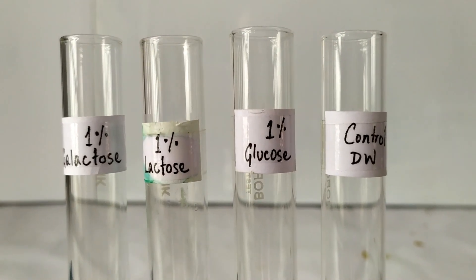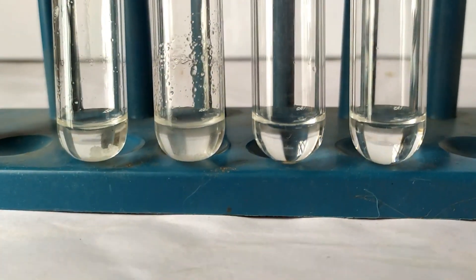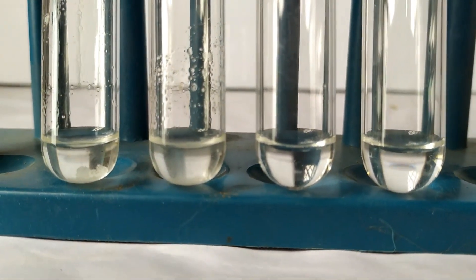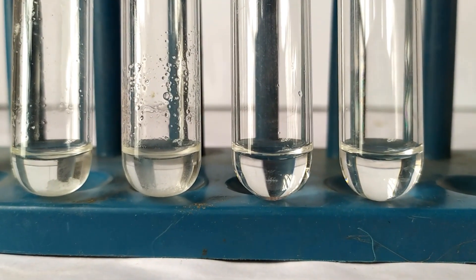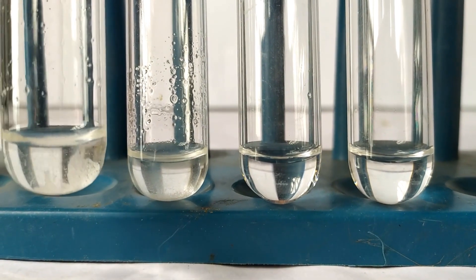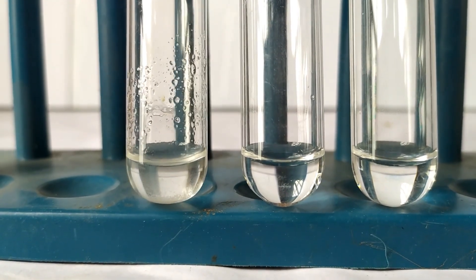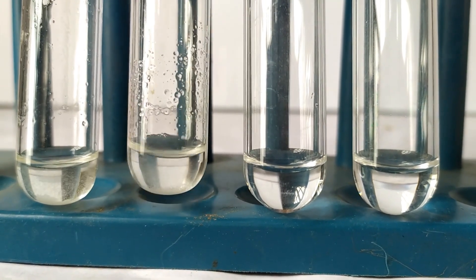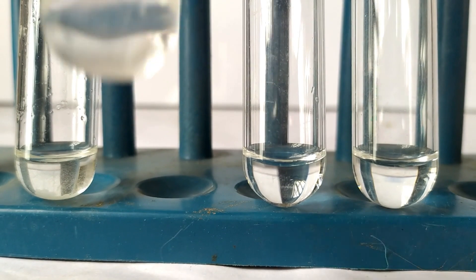At the end of 12 to 24 hours, the formation of insoluble white crystals at the bottom of the tube indicates a positive result, which means that the sample solution has galactose or its derivatives. In our experiment, tubes 1 and 2 show positive results since they contain galactose either as itself or as part of a more complex carbohydrate — in this case, lactose.